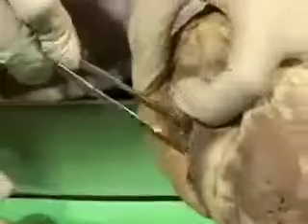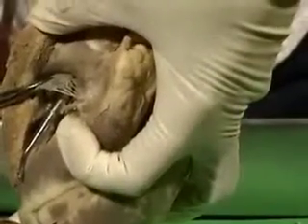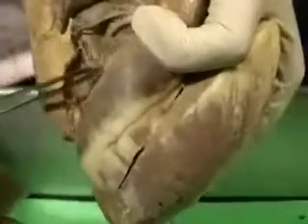And now you can see the cusps. See the cusps and see the chordae tendineae attached to the cusps. This is one papillary muscle here. You can see I'm pulling on the chordae tendineae and they are attached to the cusps. Pull this down. You can see the other cusps over here, the chordae tendineae, and this is another papillary muscle. This is part of the interventricular septum, which is separating the right ventricle from the left ventricle. So this is how blood enters into the right ventricle from the right atrium through this atrioventricular opening.